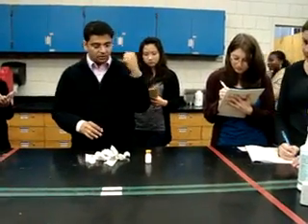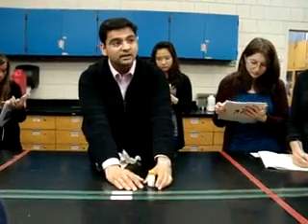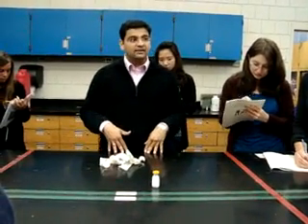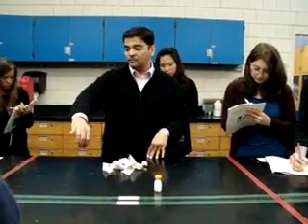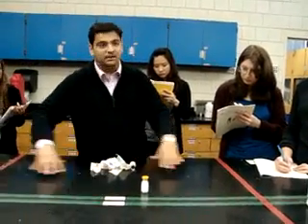Now in the hood, we expect you to work somewhere in the middle — not too much on either side. We say about 6 inches from both sides. So 6 inches is about this much — somewhere in the middle.